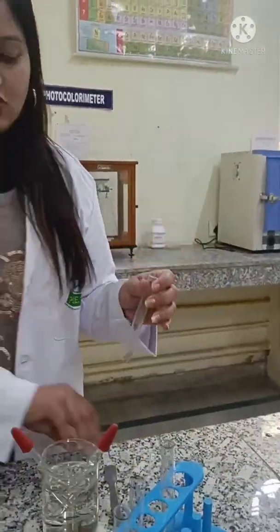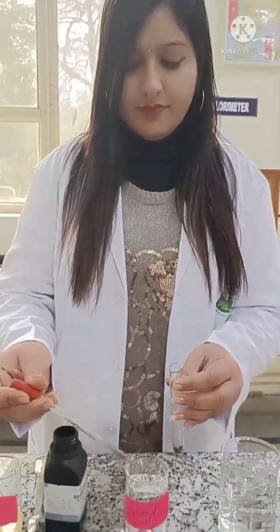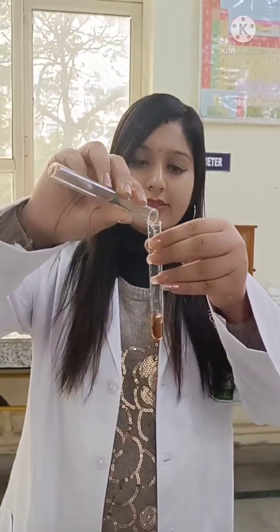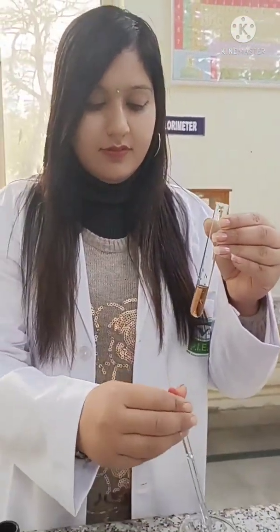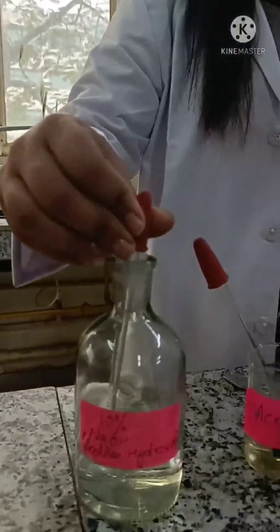In another test tube, take a small quantity of sodium nitroprusside and dissolve it in distilled water. Then add the organic compound acetone, followed by a few drops of 10% sodium hydroxide.